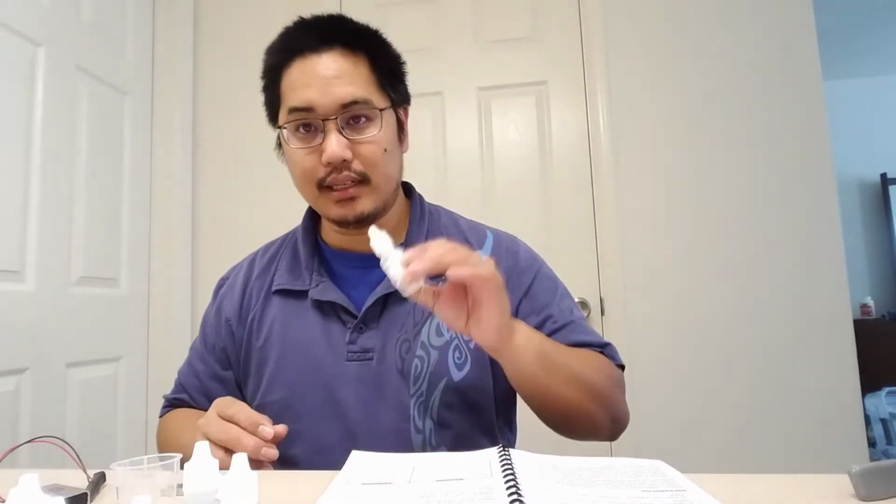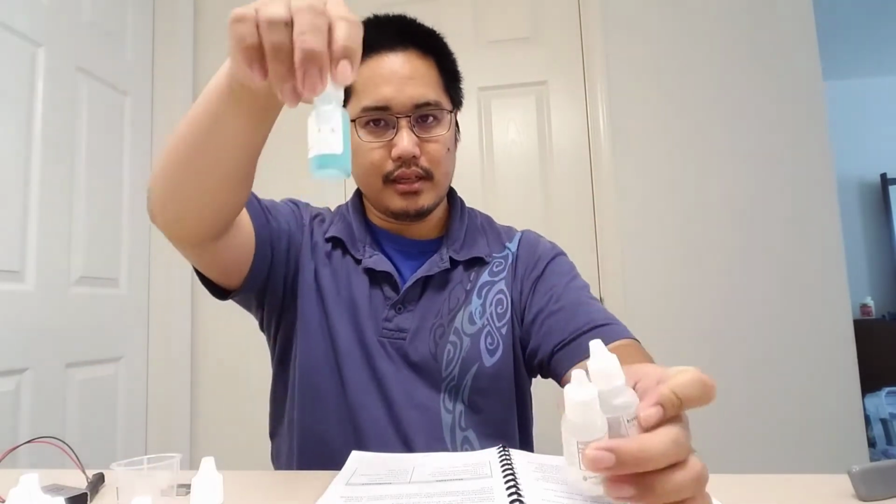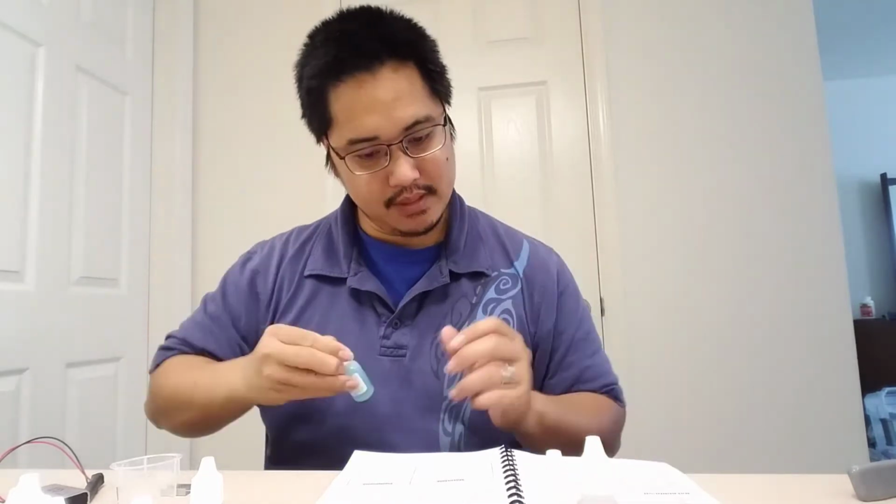All right, electrical conductivity. Sorry, I mumbled there for a second. We're going to deal with acetic acid, potassium hydroxide, copper nitrate, a nice pretty blue one, some glycerin, and sucrose. Oh man, I forgot the sucrose. It's downstairs. It's table sugar.